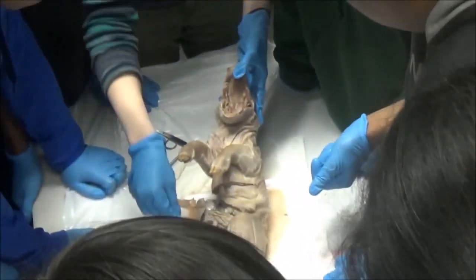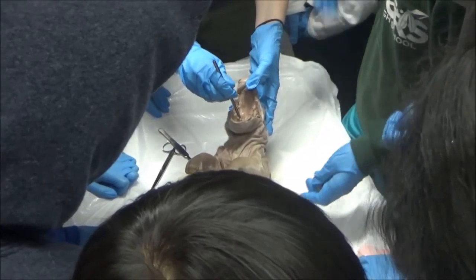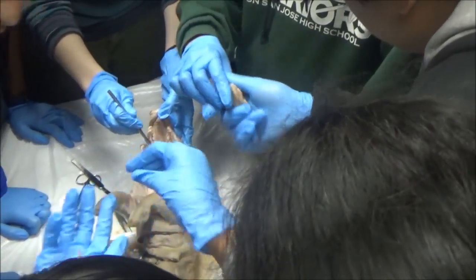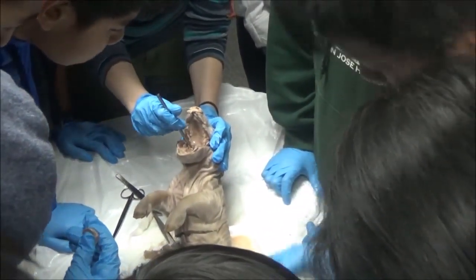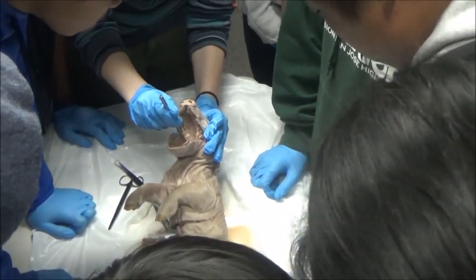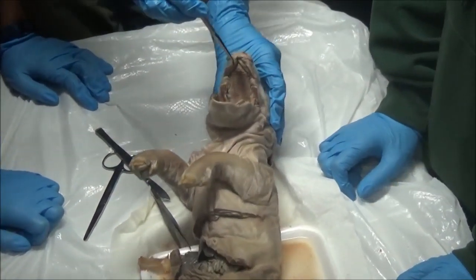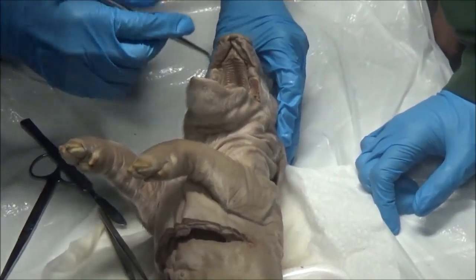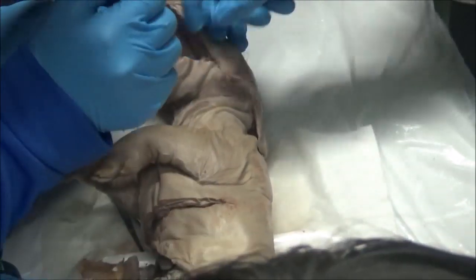Without the tongue in the way, we can really see what's happening here in the back of the throat. We have this thing right here — that thing is the epiglottis. If we carefully look below it, we can see the pipes: the esophagus and the trachea. The teeth are in the mouth — they're like fang thingies. Don't touch the teeth, you're going to puncture yourself.